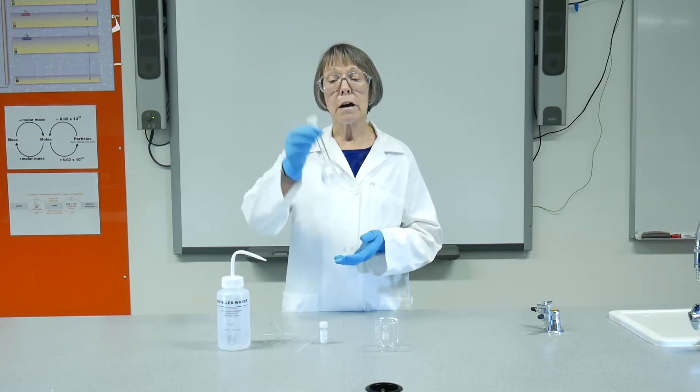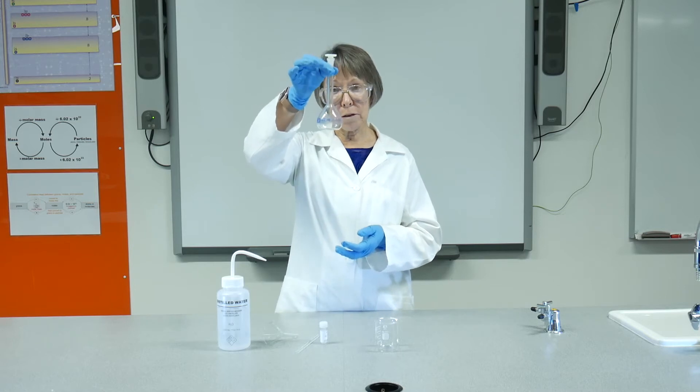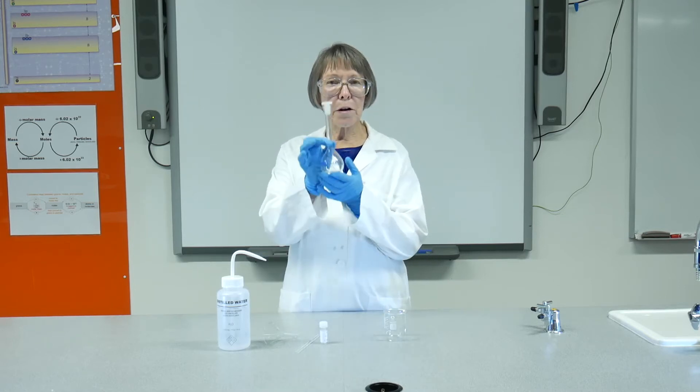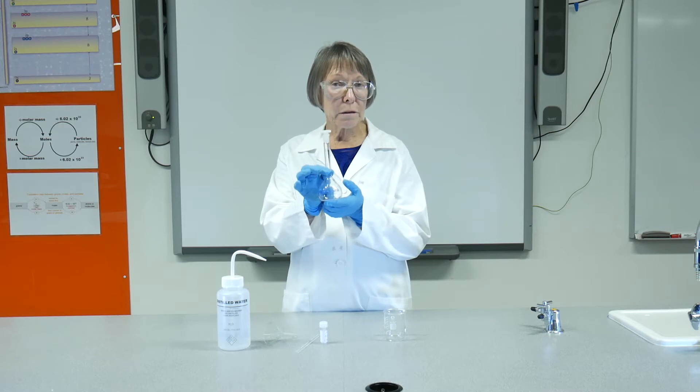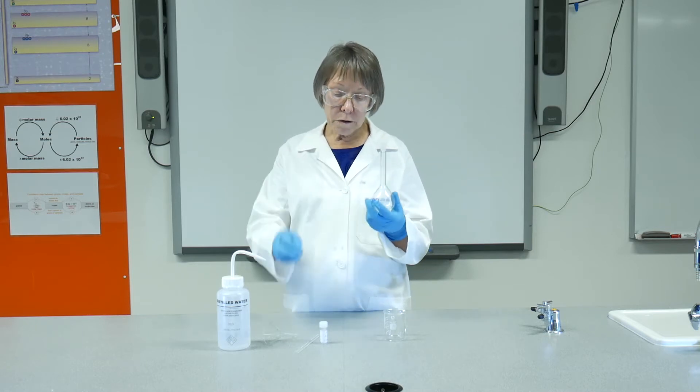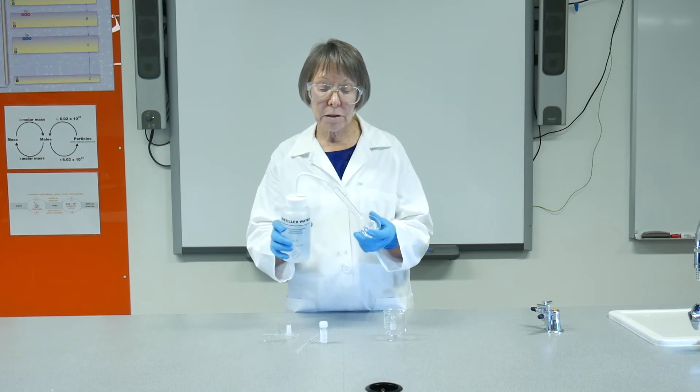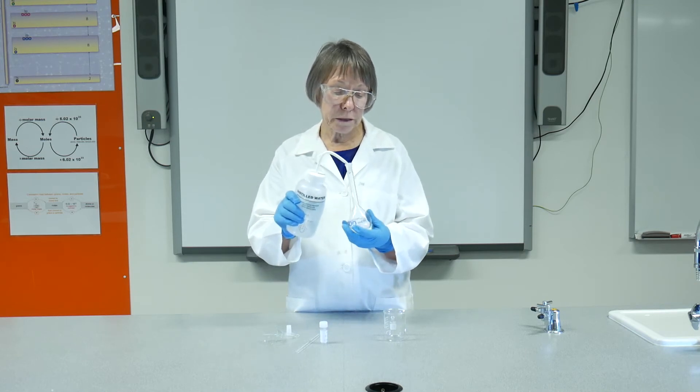In order to do that, I need to use a volumetric flask. This one that I have here today is a 100 mL volumetric flask. Of course, I need to rinse as I do everything else - three small rinses with distilled water.